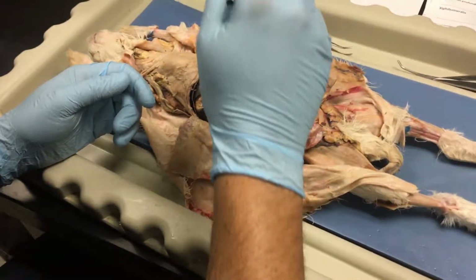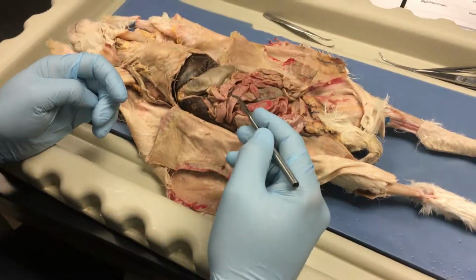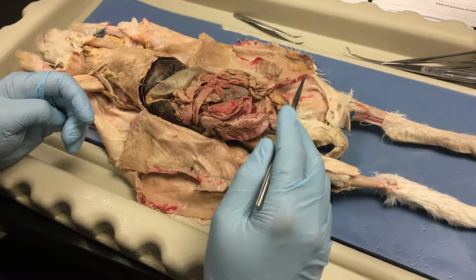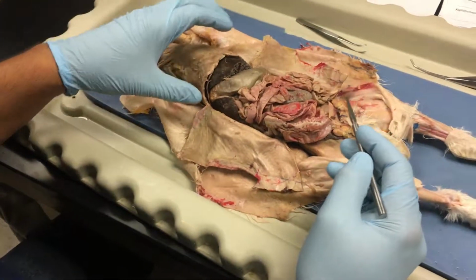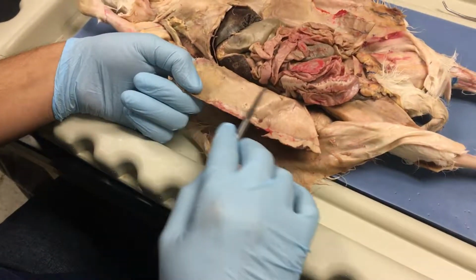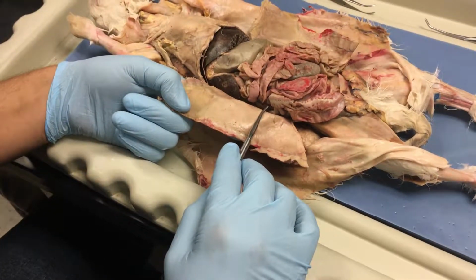Each one of these membranes actually has a different function in addition to that, but in order to simplify, if you put that down as the function for any membrane, if I ask you the function for a membrane, then you're okay. You get the points, okay? So, for example, we're going to start with parietal peritoneum right here. Its main function? Produce fluids to reduce friction.